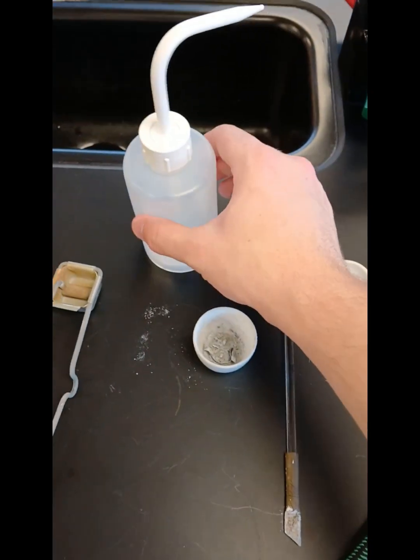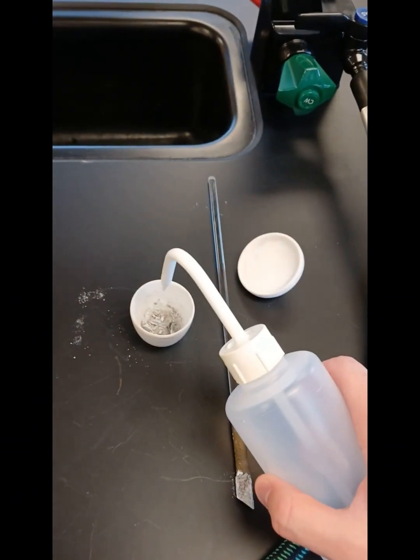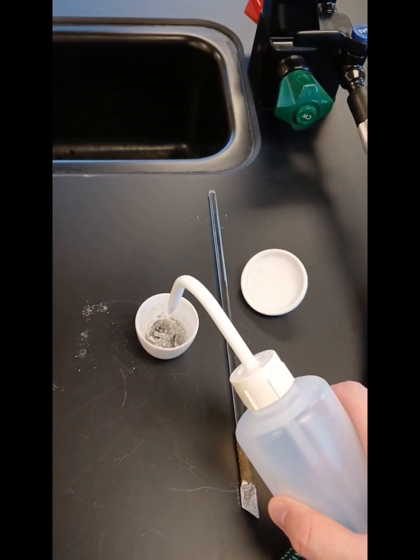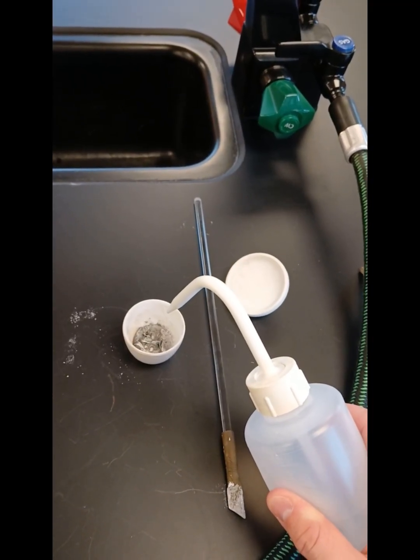After crushing the material, pour 10 drops of distilled water into the crucible. This will convert it into magnesium hydroxide. Put the lid back on, then place the crucible back onto the clay triangle. Turn the gas on and light the Bunsen burner to begin heating the crucible again. Make sure the heat is gentle for the first 5 minutes.